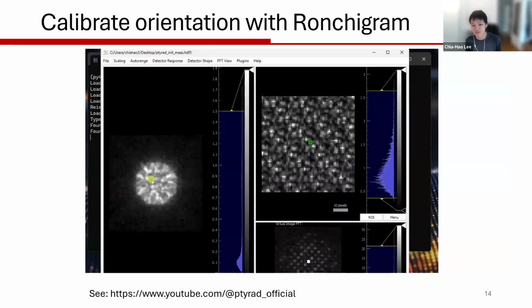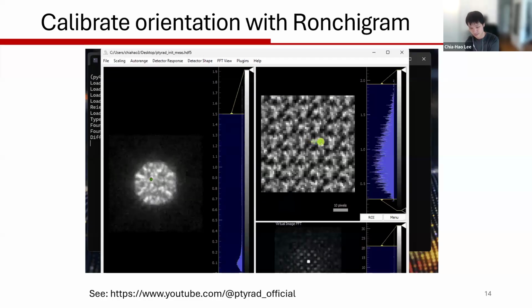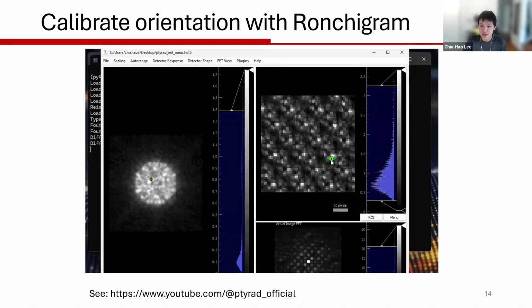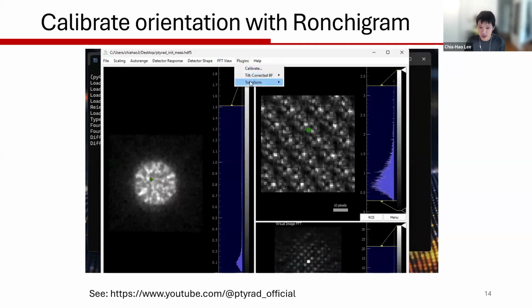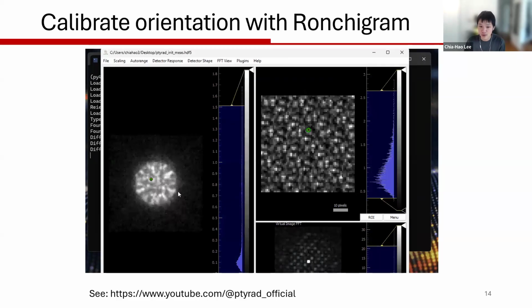So I actually built this small plugin into Py4DGUI, which is a fantastic visualization software maintained and developed by Dr. Stephanie Ribet, currently at Cornell, but previously at Berkeley. I just made this plugin so that you can check your data orientation in Py4DGUI. Once you have your data orientation correctly set up in Py4DGUI, you'll be able to just use the exact same flips in PtyRAD so they can get the reconstruction running.